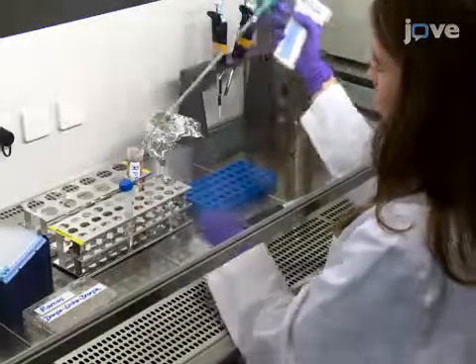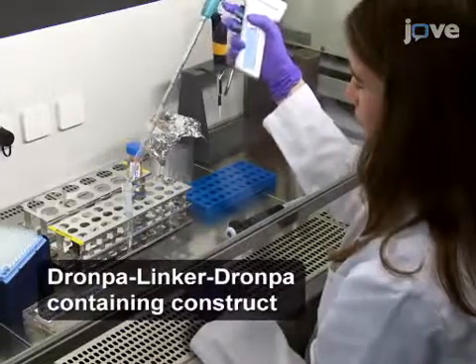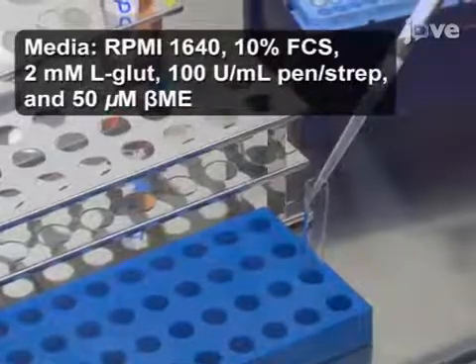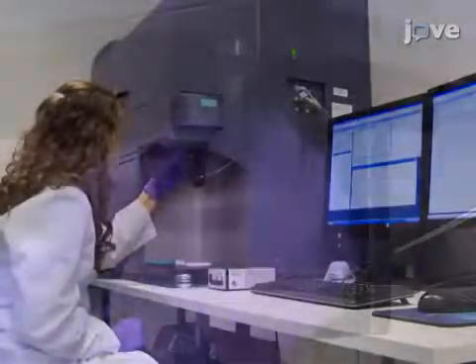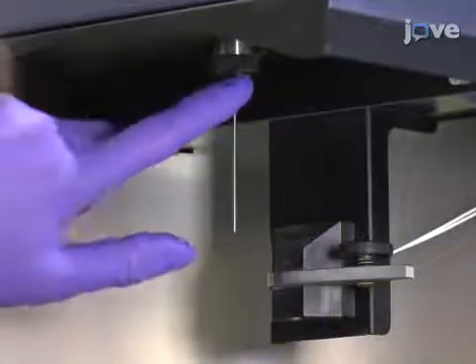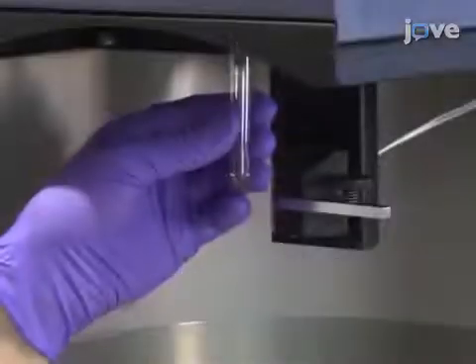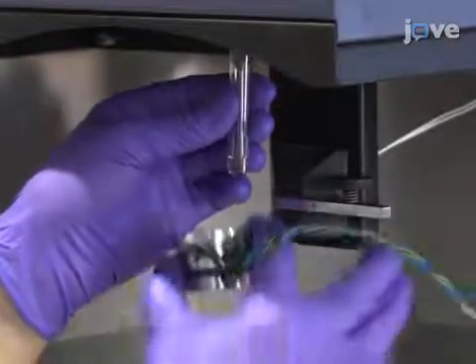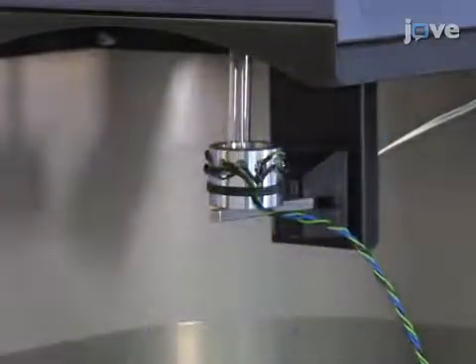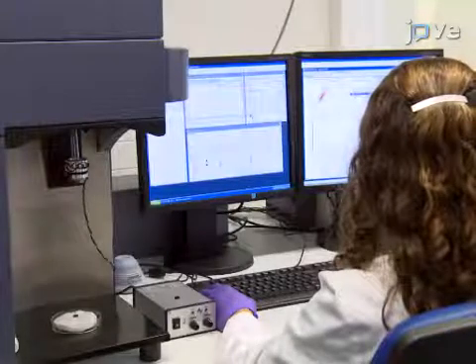To begin, suspend transduced Ramos B lymphocytes at a concentration of 1 million cells per milliliter and transfer them to a glass FACS tube. Next, exchange the black O-ring of the flow cytometer with a rubber O-ring and apply silicone grease to create a better seal. Insert the glass tube into a flow cytometer and place the LED prototype around the tube with the lights off. Measure the fluorescence intensity of DRONPA in the GFP channel.